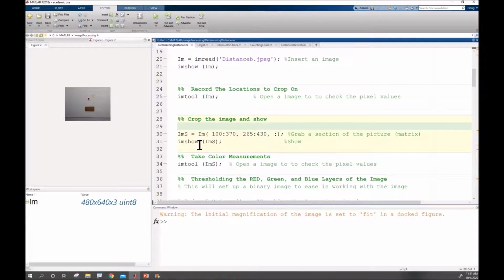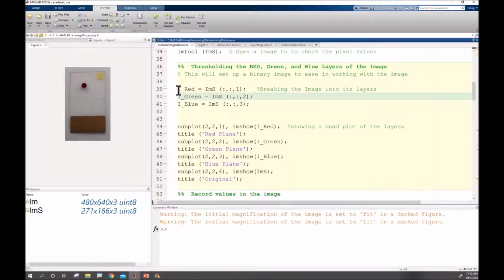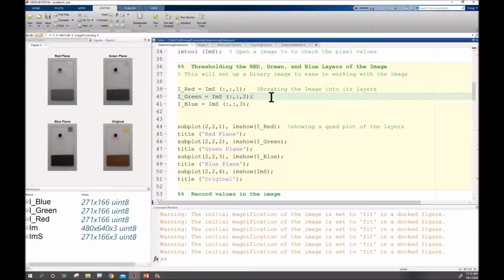So then I can take the rows and columns that I've determined, and I can take everything else and section that down for what's going on. The reason we have the colon here is because it is still an RGB image, and so it's going to have a layer for the red, a layer for the green, and a layer for the blue. Once it's there, we're going to split the image so that we have an image that is red, an image that is green, an image that is blue, and we're going to see that on our planes. So let's run that section.